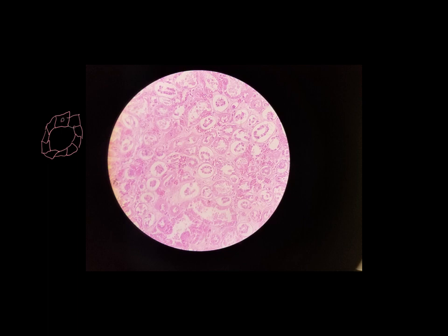And the nucleus of simple cuboidal epithelium tends to be pretty round, pretty spherical, not stretched out the way that we saw it in the simple squamous epithelium. So something kind of like what I've drawn here. Now, this slide is a perfect example of what I mentioned previously. There are several different tissue types on this slide, but we can see lots of examples of simple cuboidal epithelium. All of these ring-shaped structures. These are all simple cuboidal epithelium.